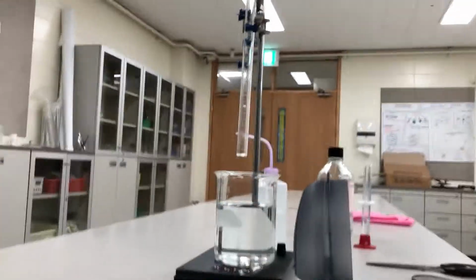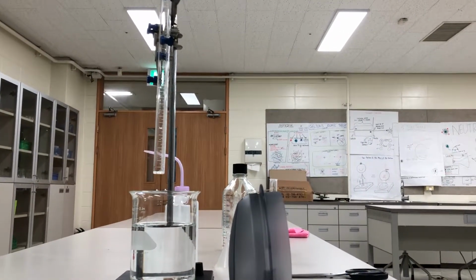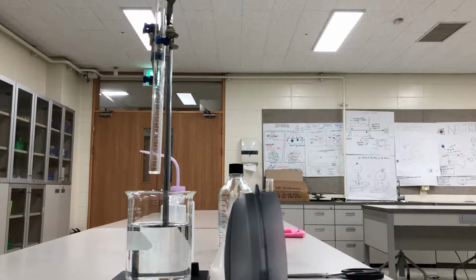So what I'm going to do from here is I'm just going to put this here so that you can follow along with what I'm doing. So in your laboratory notebook, in your table of contents, you can just call this the gas law demo or the determination of R demo. And then once you have that set, flip to the actual page where you're going to do the lab, and you'll want a very simple laboratory setup, okay? And I'll zoom in and out so you can see what's going on.